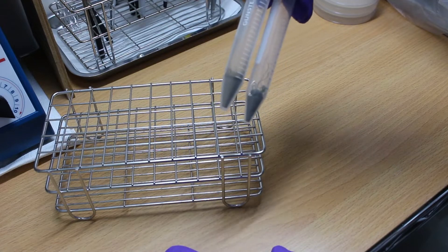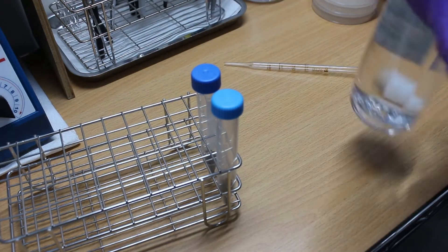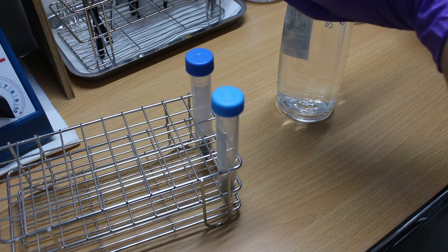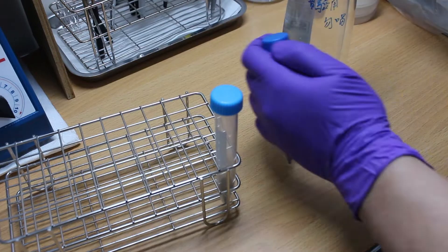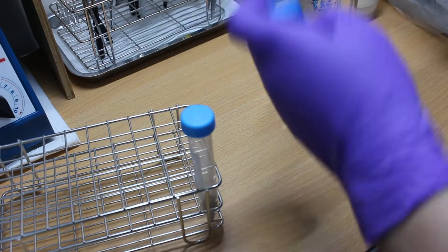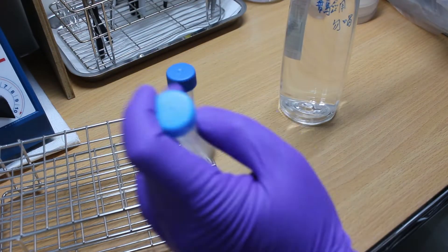Next, add some water to the soil and shake it to wash out the bacteria. It is better to use boiled or bottled water which is cleaner. You can add 10 milliliters of water to each gram of soil, or you can dilute it even more. I would say 10 to 100 thousand times dilution will be fine.